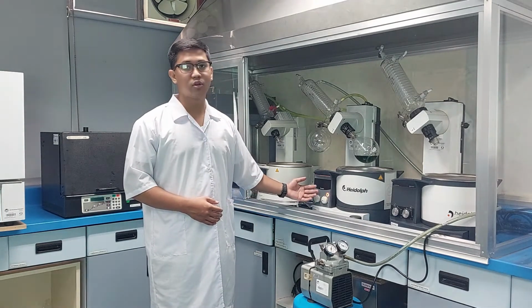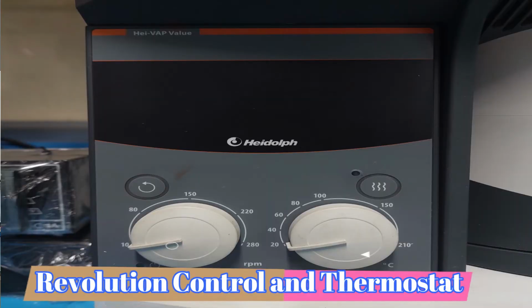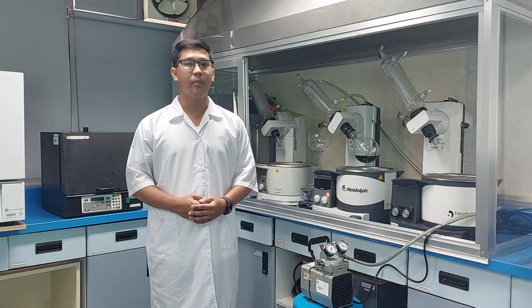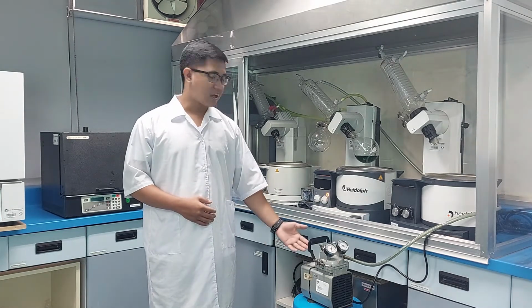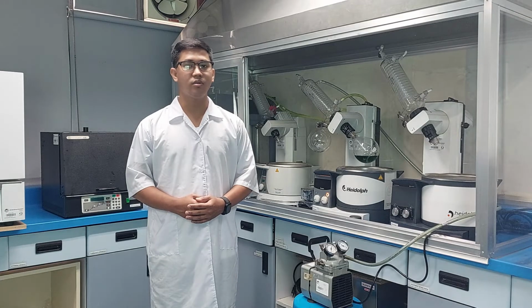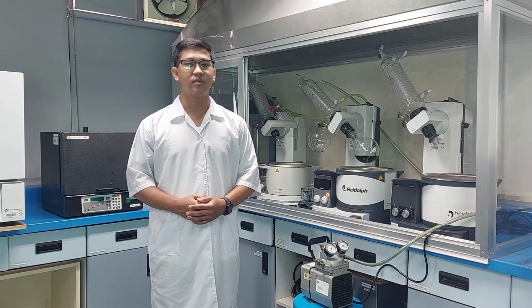Thermostat and revolution control. It exerts control by switching heating or cooling devices on or off, or by regulating the flow of a heat transfer fluid as needed to maintain the correct temperature. Vacuum pump. It removes gas from the sealed equipment to leave behind a partial vacuum in order to create a continuous feed system and keep the purity of extracted solvents.